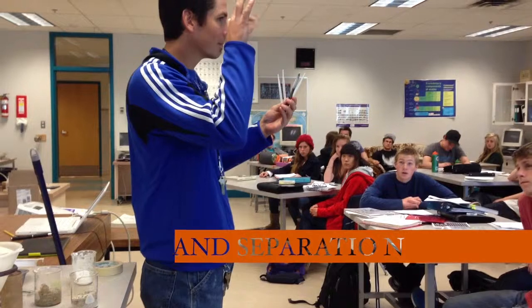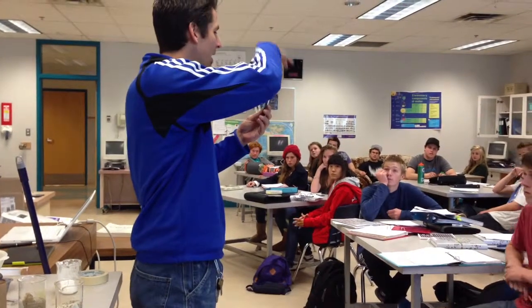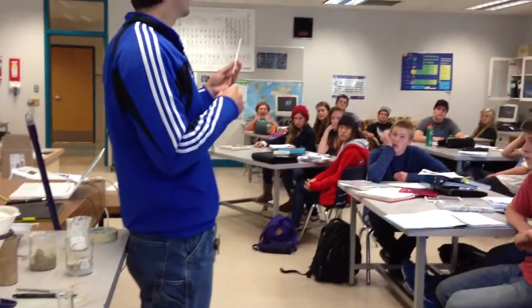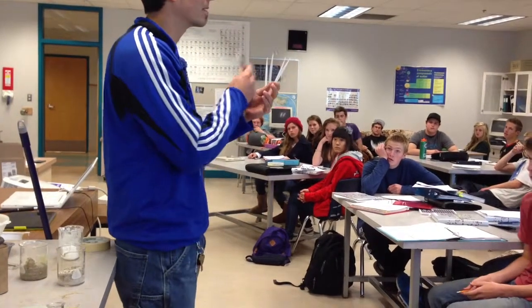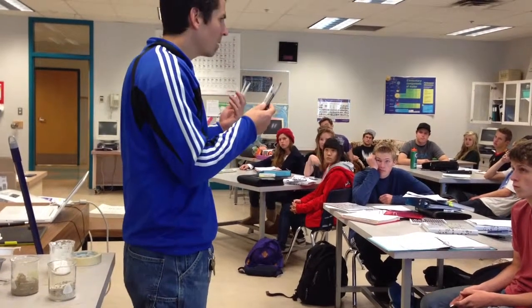pipettes. How am I going to do it? With my hand, and I can just pull them out. Now, in order to be able to figure out which ones to pull out, I took advantage of a property of the pens that was different from the pipettes. What's the difference that allowed me to do that? Their appearance. They look different.